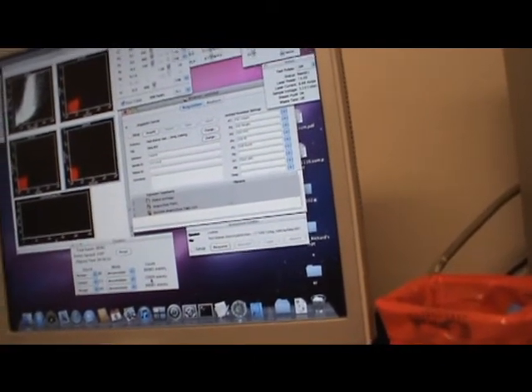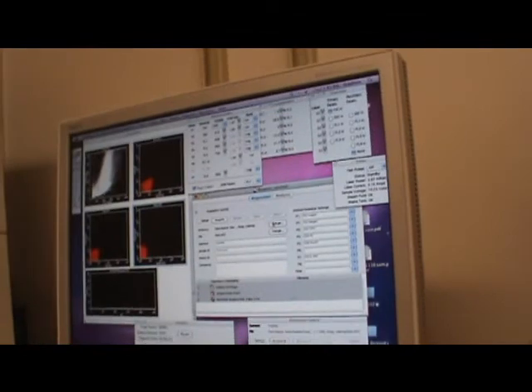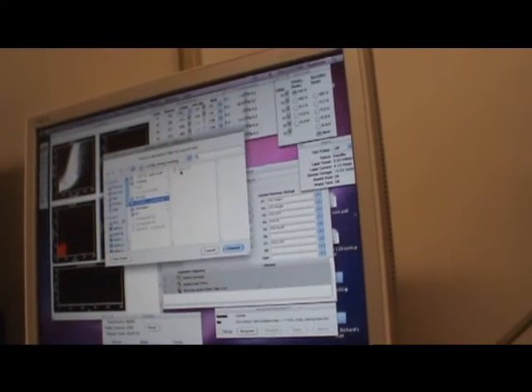So you take it out. And it says data 2. If you go back just to check, it shows you that the data is recorded. Because it says data 1, that means you can confirm.